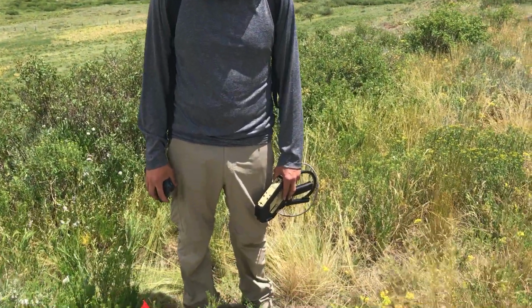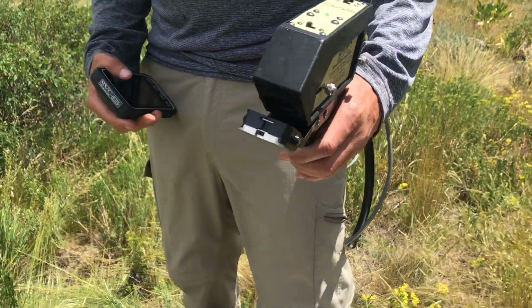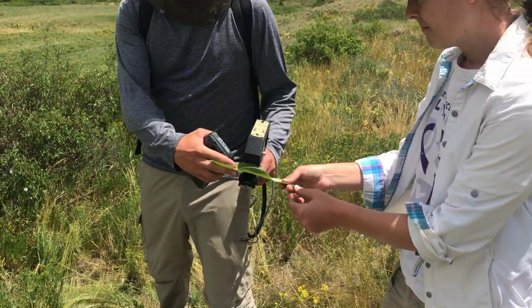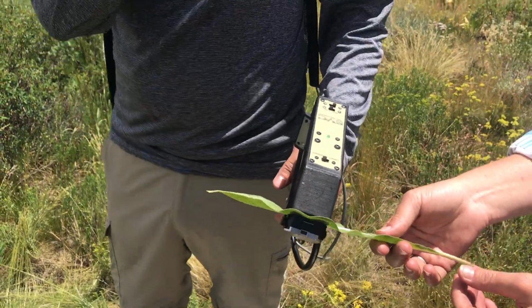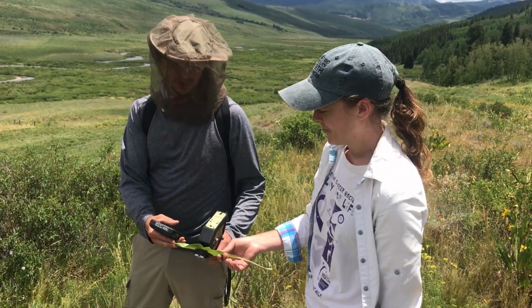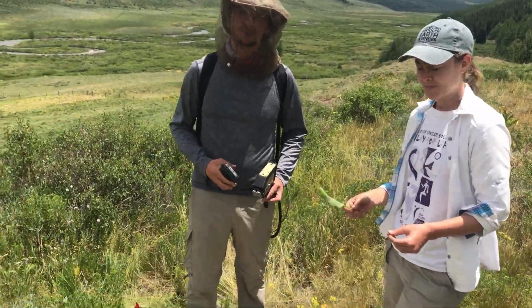Excellent. And so this is the handheld hyperspectral imaging device? This is the handle, and it has a clip where we can insert the leaves. It has a lamp that we can use as a source, so we don't need any solar measurement or solar radiation. So we are totally independent of the weather conditions this way. Excellent. That makes life a lot easier.